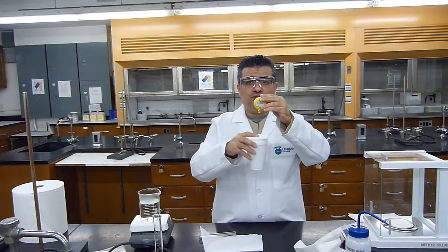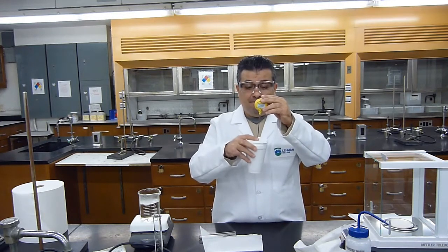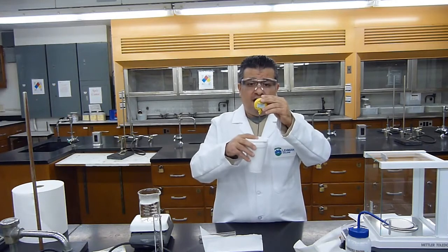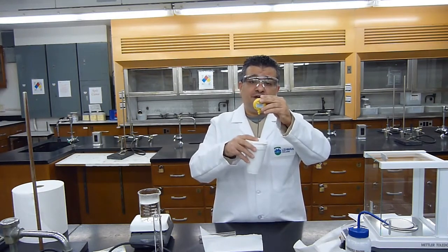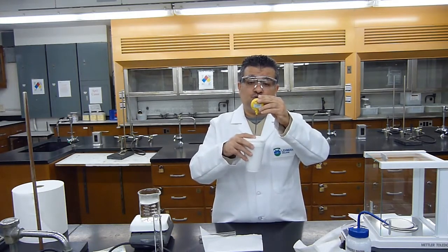Okay, just make sure you give it a good mix inside. This way all of the energy that the metal contained will be transferred to the water. Now I began at 25.2 degrees Celsius. My current water temperature is 32.7 and it just jumped up to 32.8.